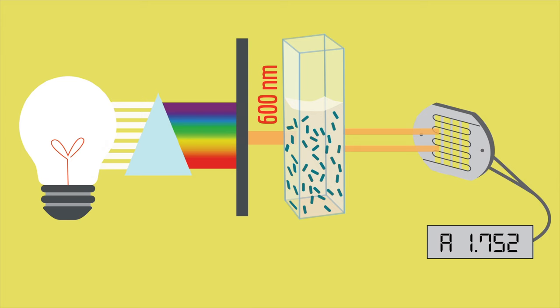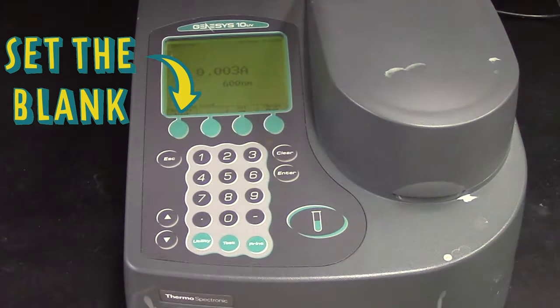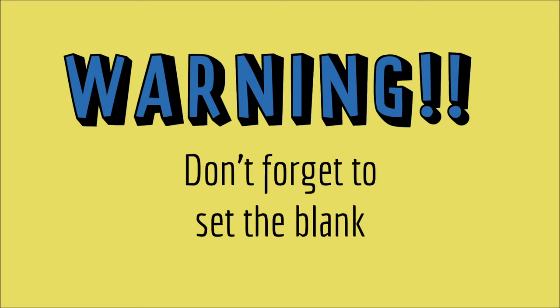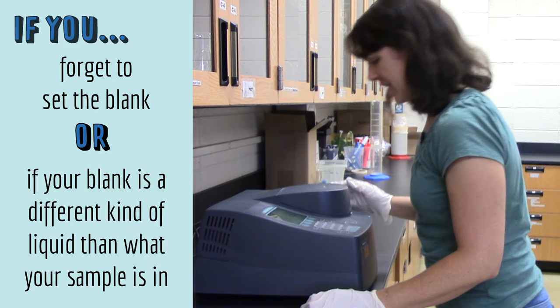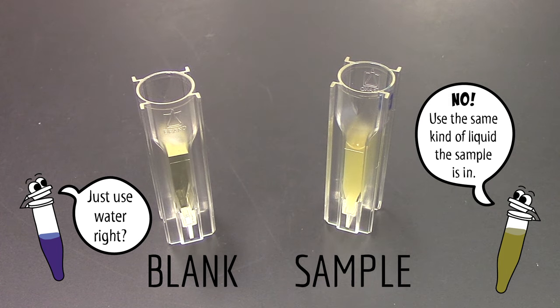Almost everything absorbs a little bit of light, so if what you want to measure is the absorbance of bacteria, you don't want to include the absorbance of the media they're growing in. To avoid that, before you measure your sample you must set the blank. Your blank is a cuvette with the same kind of liquid that your sample is in, but without the sample in it. If you forget to set the blank, or if your blank is a different kind of liquid than your sample, you will get an absorbance value that's totally meaningless. Make sure you set the blank using the same kind of liquid that the sample is in.